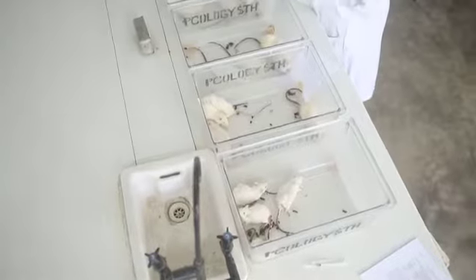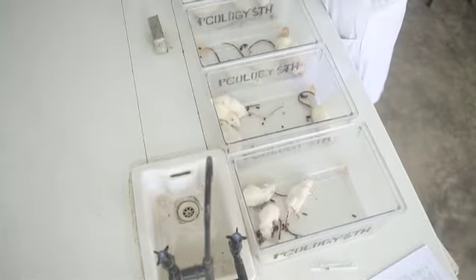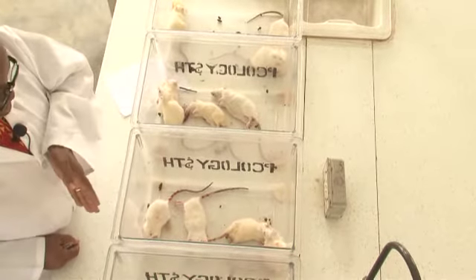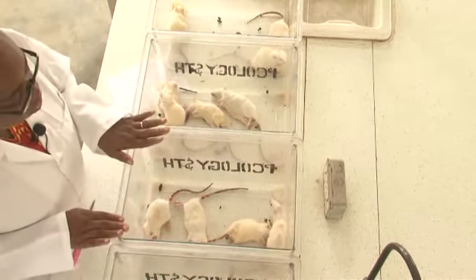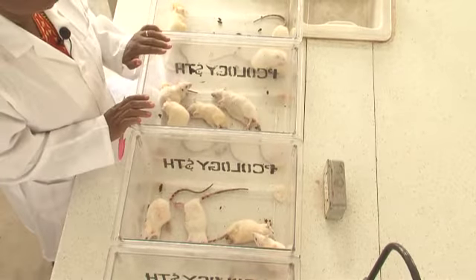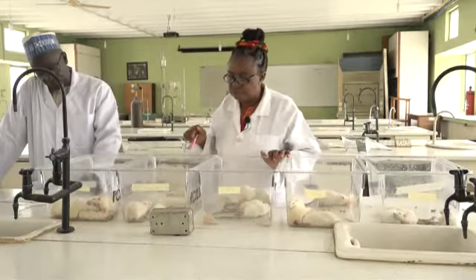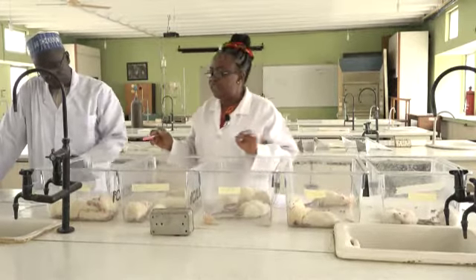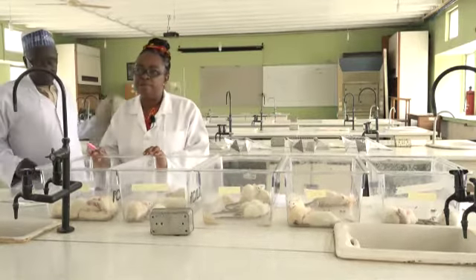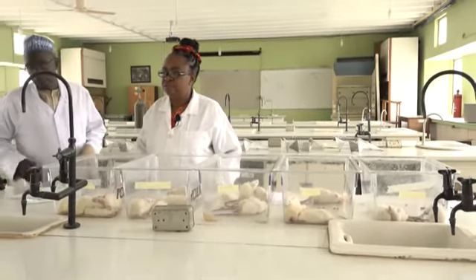In organophosphate poisoning, because the onset is so short, that is the time interval between the administration of the poison and the toxicity or death, you can get as much toxicity in this cage as in the cage that received no treatment. Hello? I hope I'm communicating to somebody. Now, this is the last cage. You poisoned them. He's going to poison them now. Then he's going to wait 20 to 30 minutes before giving the antidote.